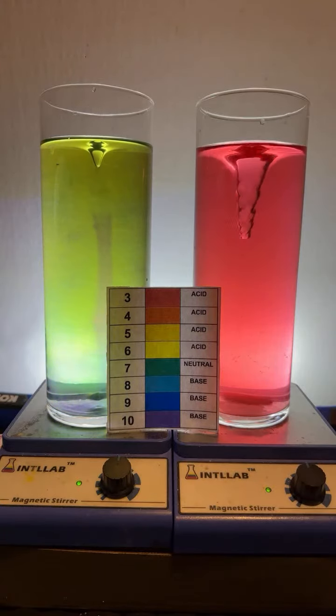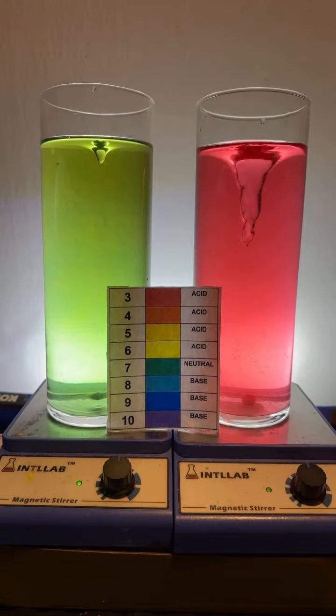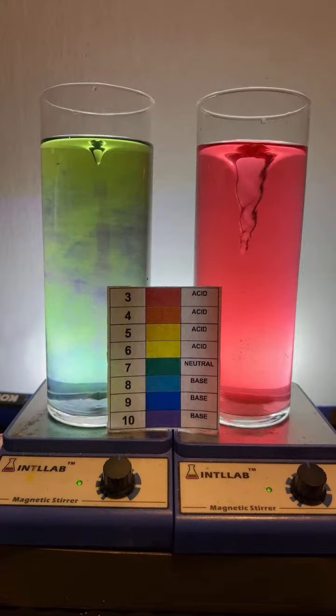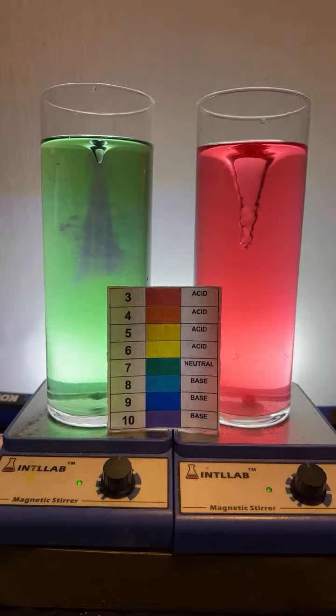There's your deep red turmeric. Oh, Pollock. Yes, that's correct. All right, let's add another drop of base over here so we can get that baby to teal. Another drop of base. Okay, now we're going to try this over here.